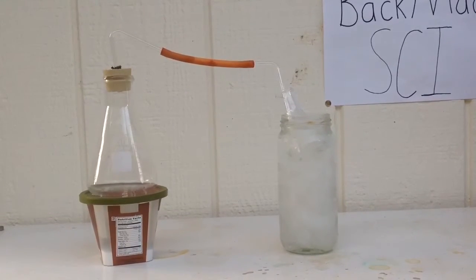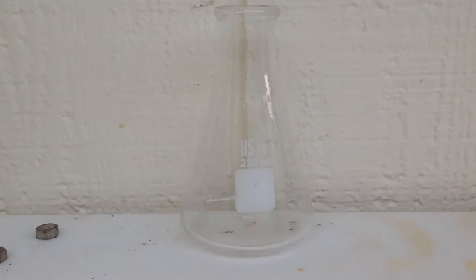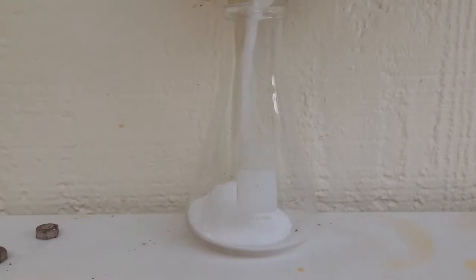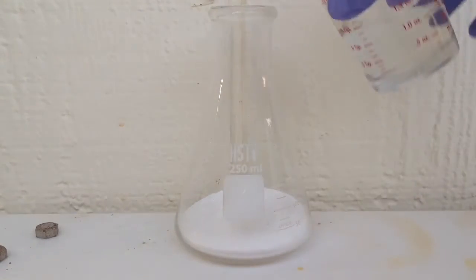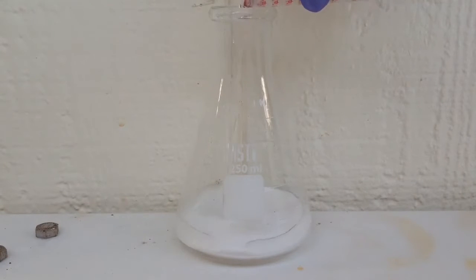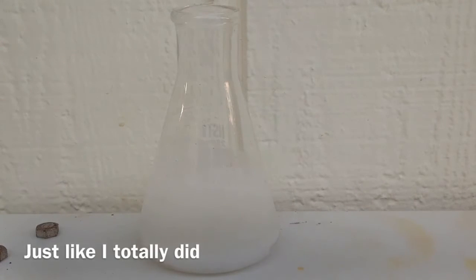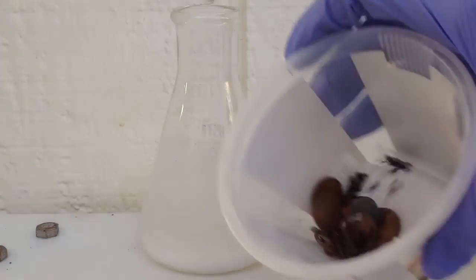First add the 60 grams of your nitrate salt. Next add your water and dissolve it. Next add the copper and mix it a little bit.